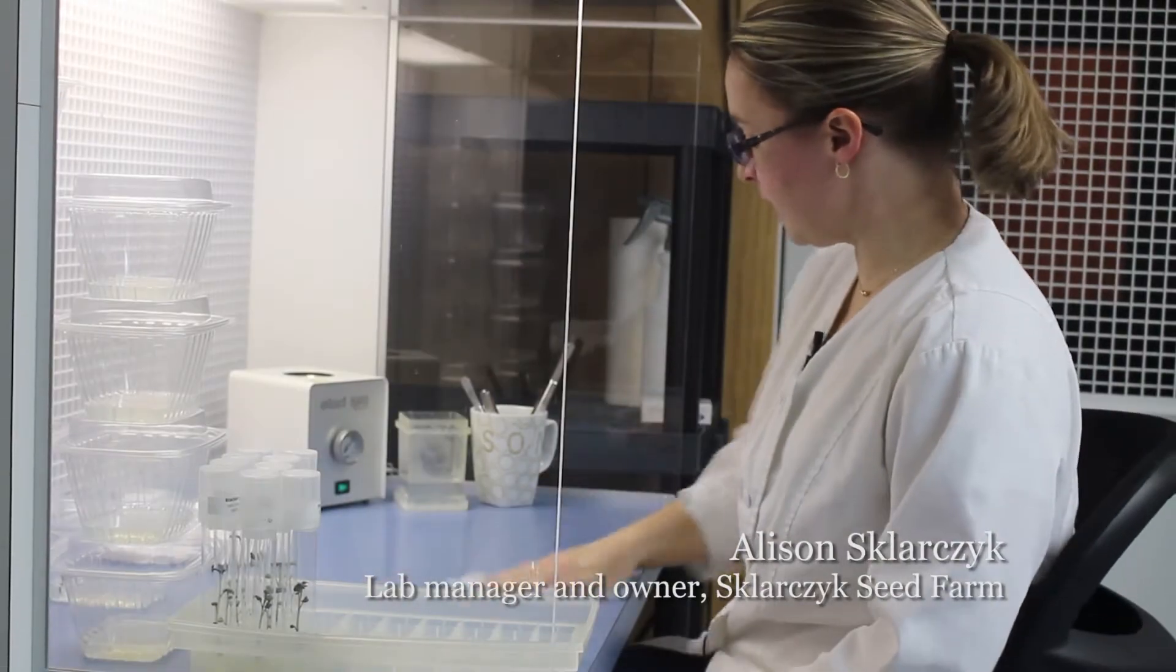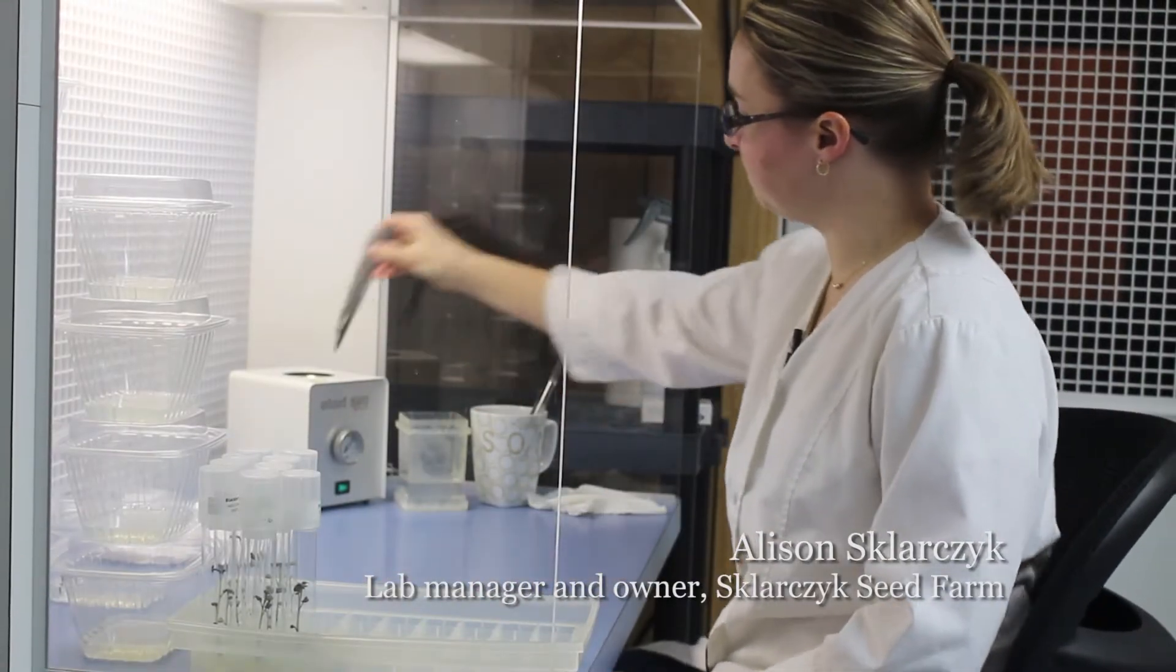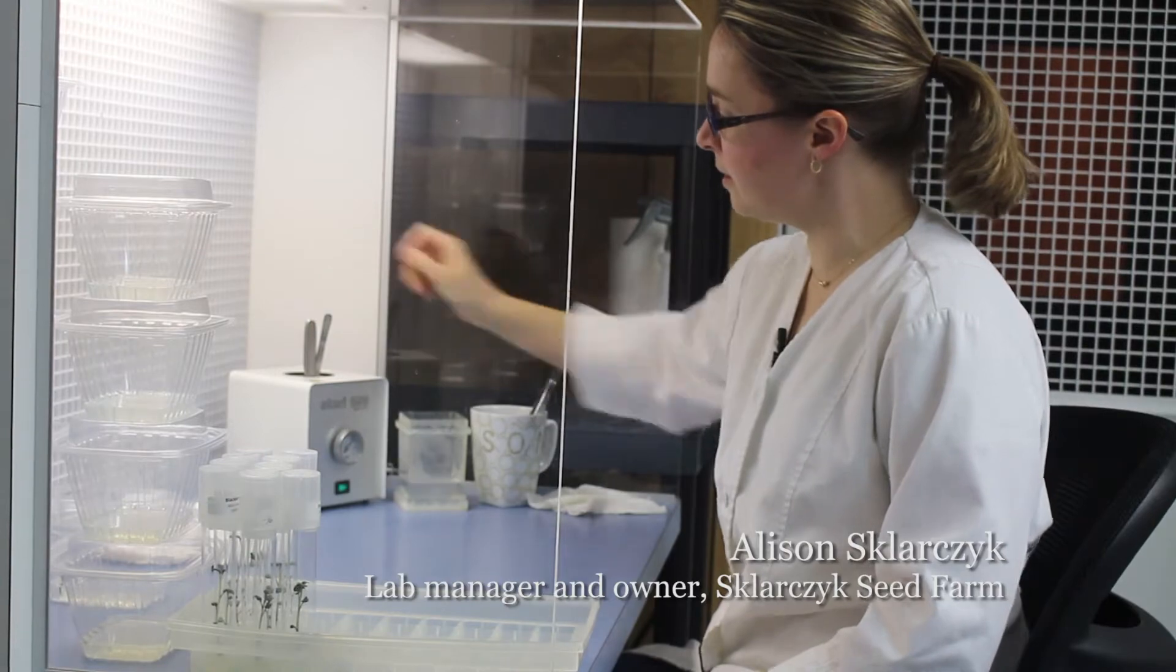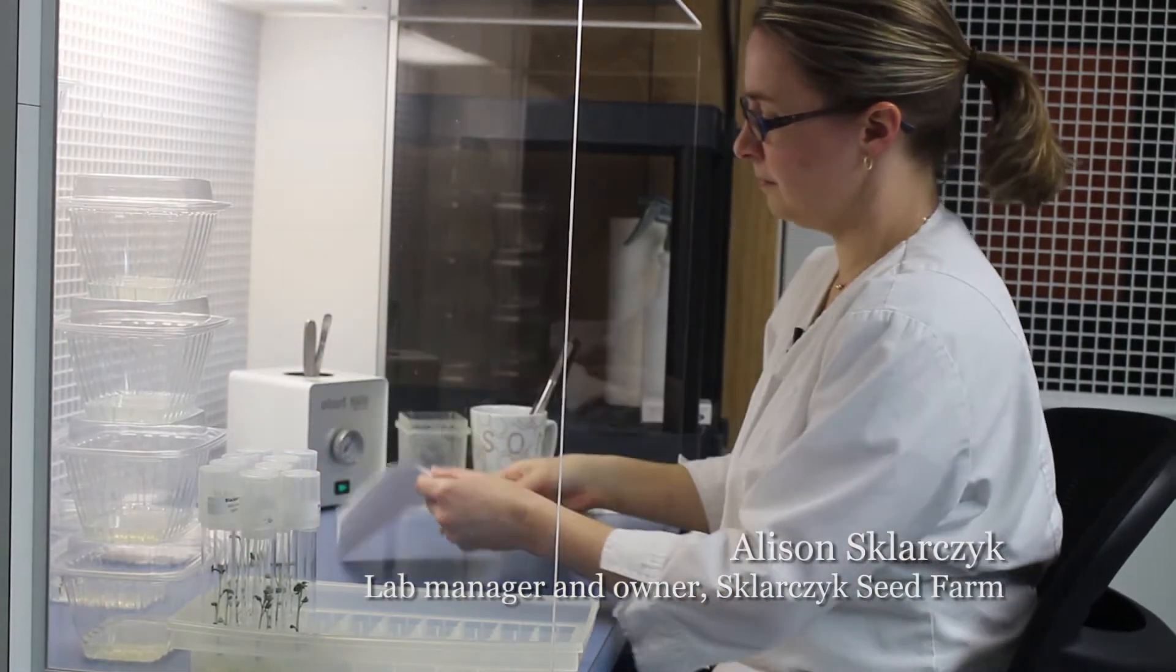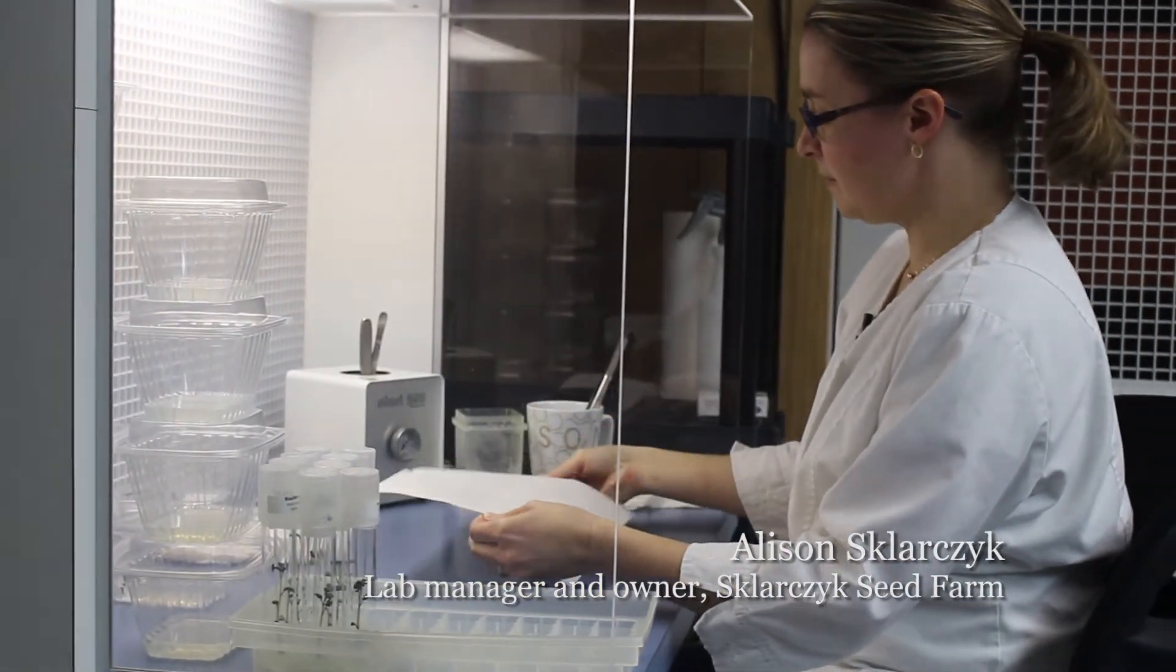So wipe down our lab cutting surface with some disinfectant, sterilize our utensils, open up a piece of sterile paper.